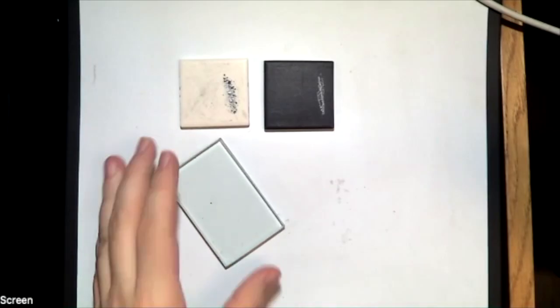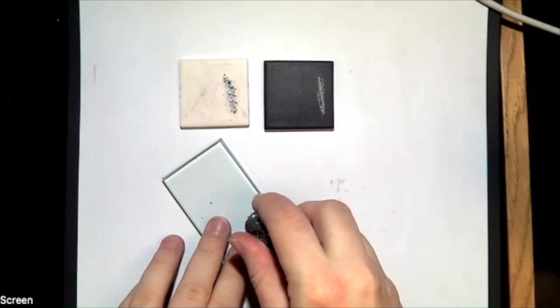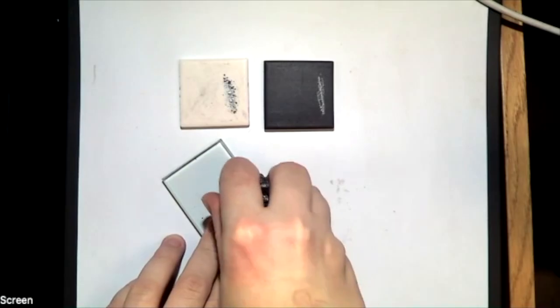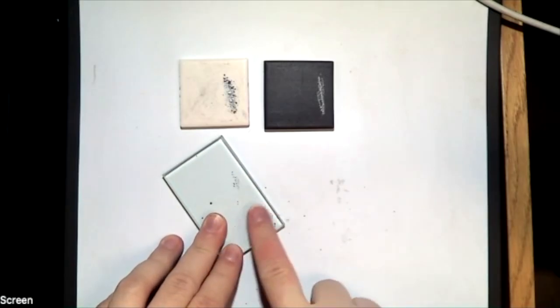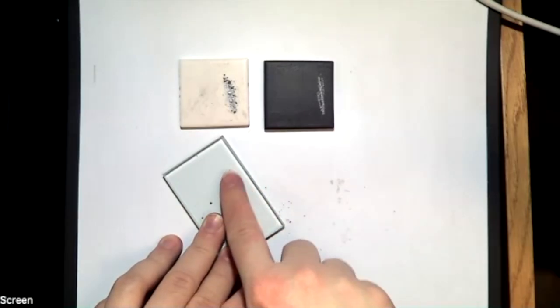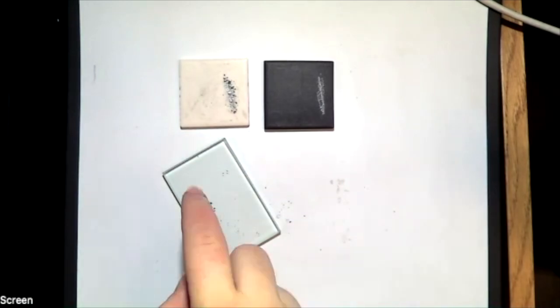Our next step is going to be moving one step down, which is going to be looking at a glass pane. Glass has a hardness of about 5.5. So if I use a material that I know is softer than glass, I'm going to do the same thing as I did before. I'm going to apply quite a bit of force. You can see the mineral is powdering on this. I'm not getting any scratches inside of the glass though. So that tells me that this mineral is softer than the glass. The glass resisted the scratching.